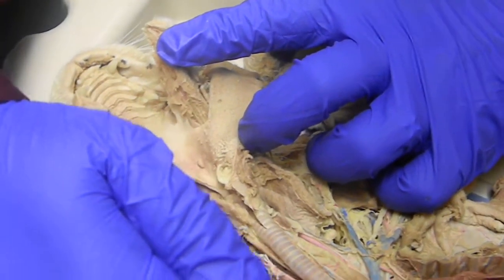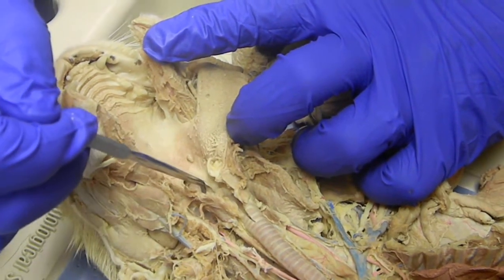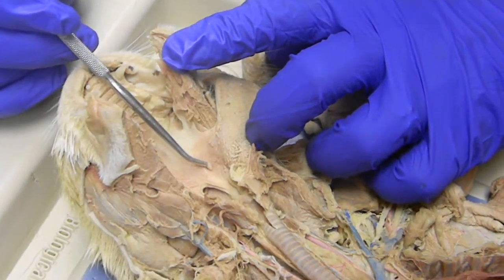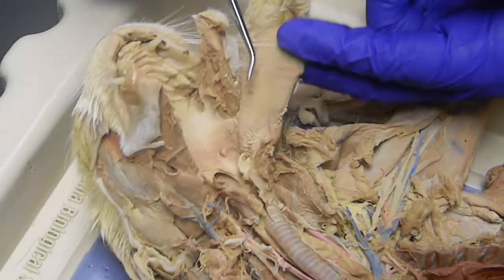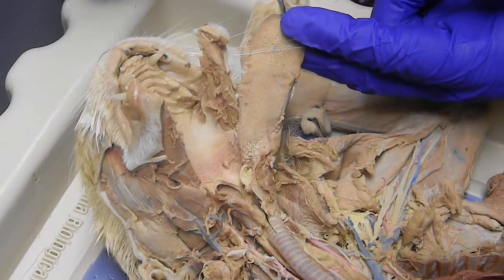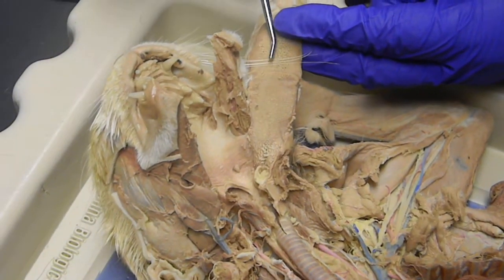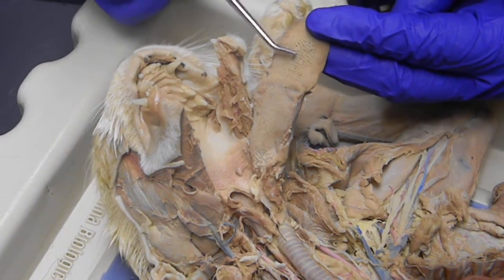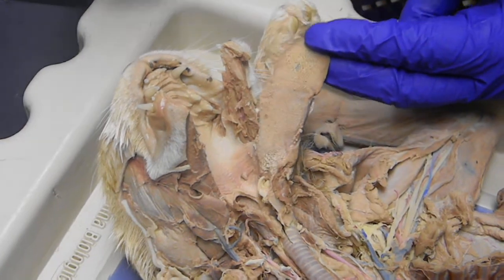The nasal pharynx is underneath, and the common opening is the laryngeal pharynx. These little nubs here are the palatine tonsils. We have the tongue itself, the apex at the tip. There is a slight indentation in the center of the lingual sulcus. We have the papillae, and the hard ones that are very spiky are the filiform papillae.